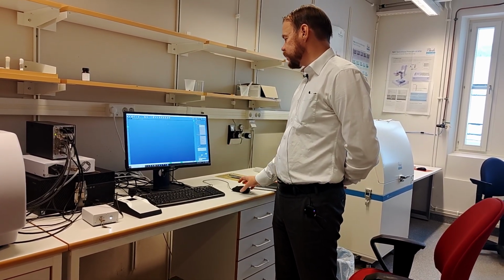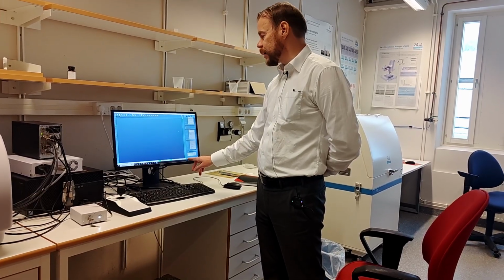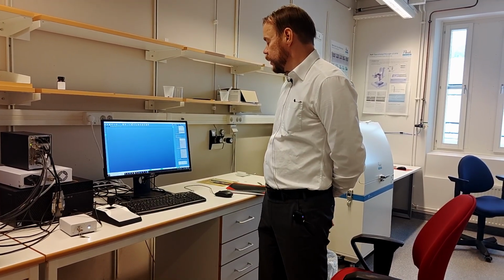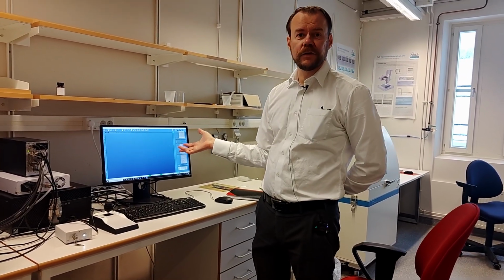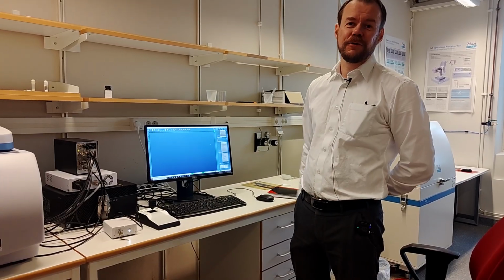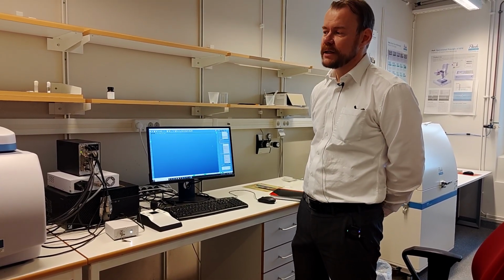And now it scans, and we wanted to scan for 1 minute. So you see this little green bar start coming up here. So we just have to wait for 1 minute. And now we're using 100% laser. There can be a risk of using 100% laser because it can damage your sample. As I said, it burns a hole in a tissue paper. If your sample is sensitive, it can damage it.